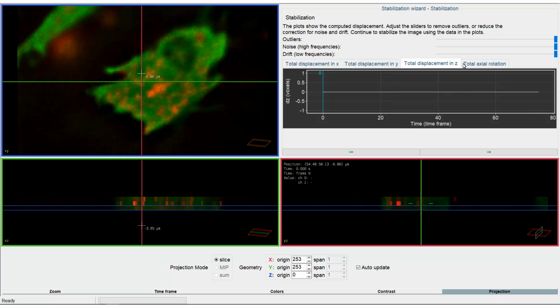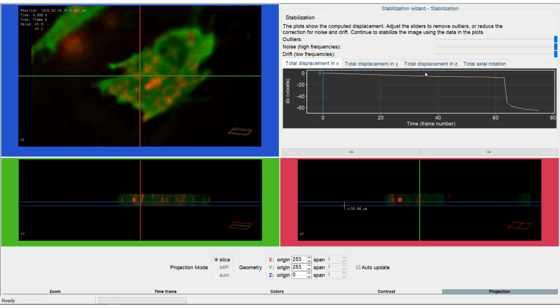In Z, that in this case was disabled. And the total axial rotation. The slowly declining line, indicating a slow drift, and the sudden drop, indicating a bumping of the microscope stage, can both be corrected by Huygens perfectly.